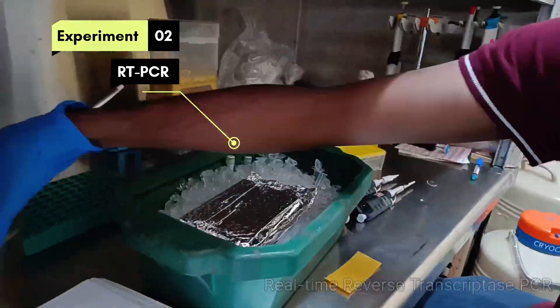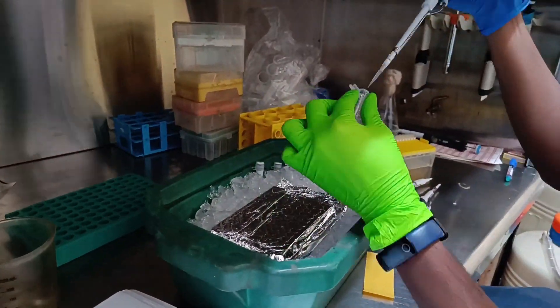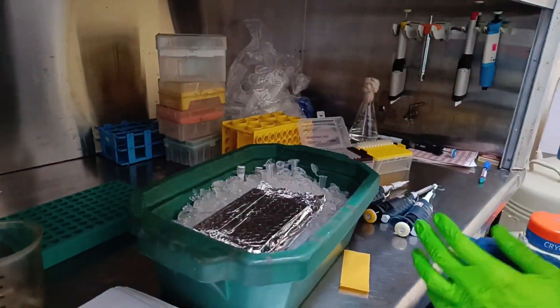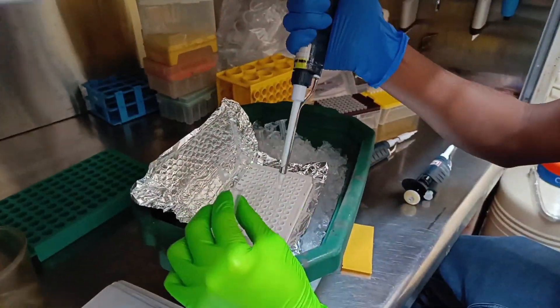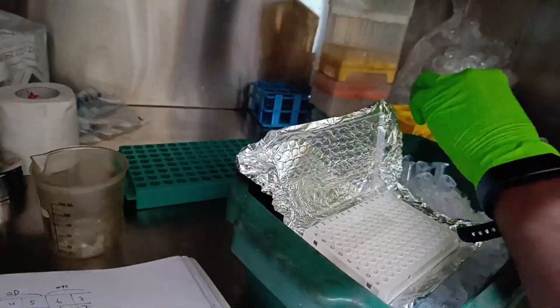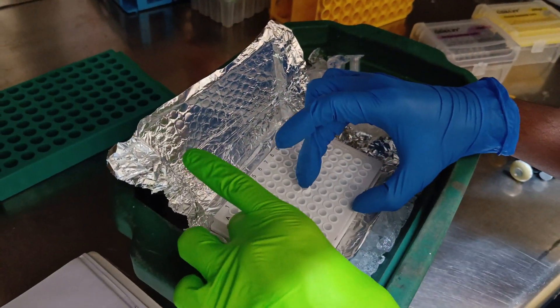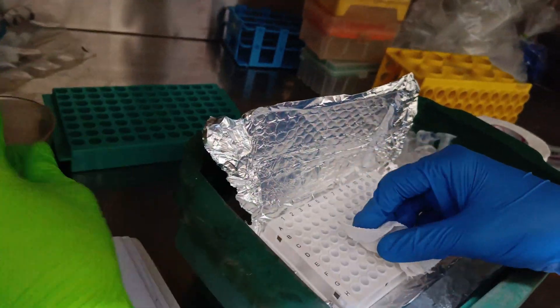The second thing I am going to perform today is setting up an RT-PCR to check the upregulation and downregulation of some specific genes in my knockout strains. I am using one-step TB Green. During the reaction, the mRNA I isolated earlier will be converted to cDNA, then the cDNA will bind with the SYBR Green and we will be able to see how much DNA amplification is happening. We will analyze this amplification data against our parental strains.